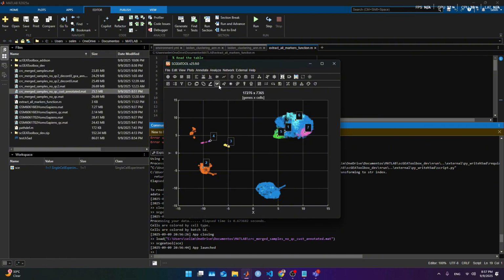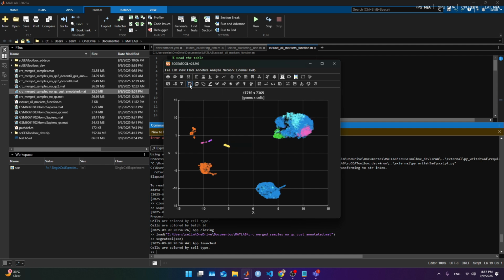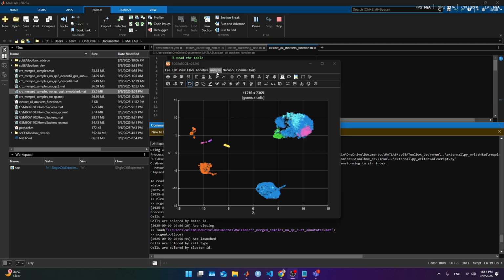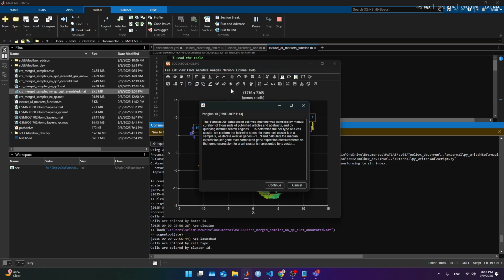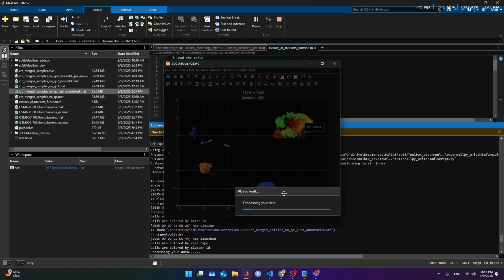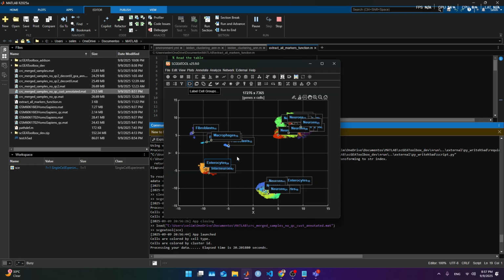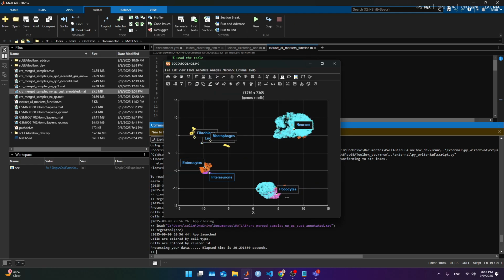I'm gonna come back now to the quality of the sample. So we had these many cell types this time, and I'll just show again that the automatic Panglao annotation brings just a few cell types, and once we process again the data, we're gonna have slightly different things. That's what I want to show. Might finish soon. That's it. We merge, and that's what we get. It seems similar to what we had before, just a little different.